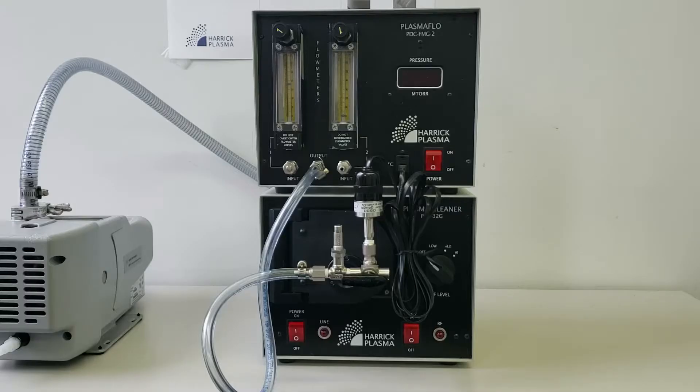We will be using the basic plasma cleaner, plasma flow accessory, and economy oxygen service pump.